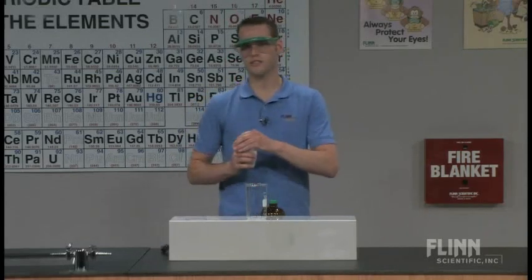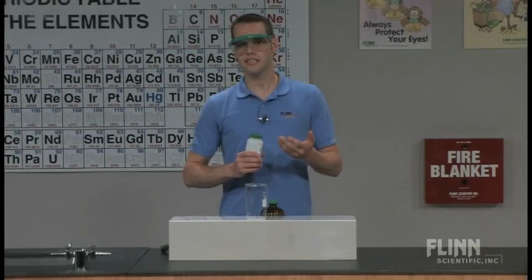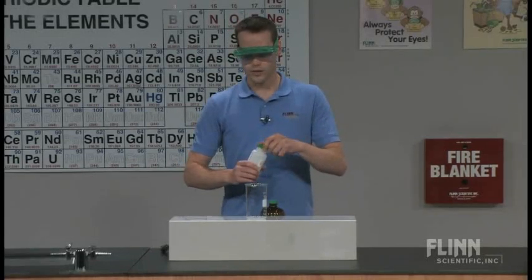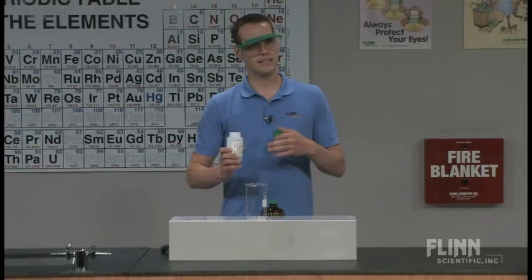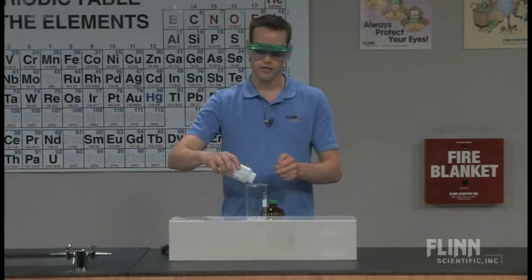I'll get the reaction started so you can start to see this. This is just a reaction between zinc and acidified tin(II) chloride. So the zinc you want is the mossy zinc. This tends to have a larger surface area so it gets to the floating tin sponge a little bit sooner than other forms do.